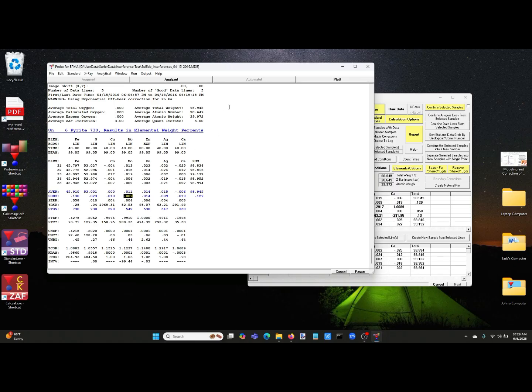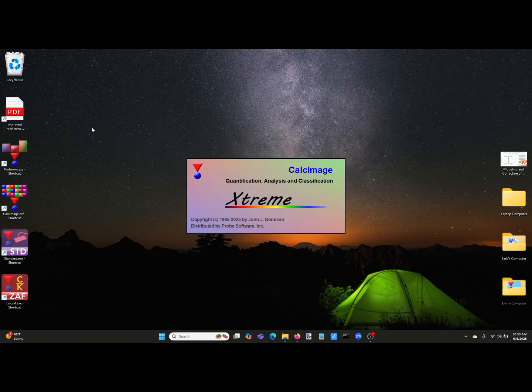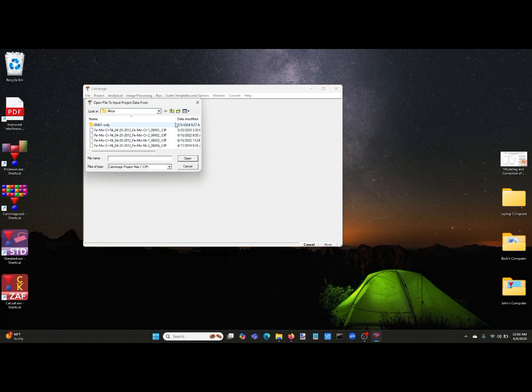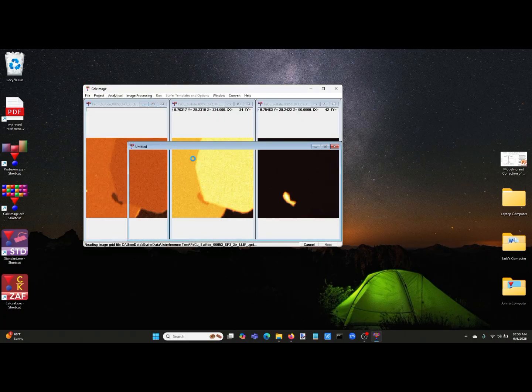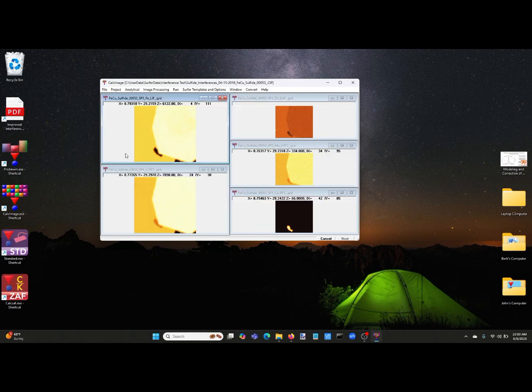Okay. Next, we can also do the same type of analysis for maps. So here's an example of a mapping run for those same elements. And we'll open up this project that we've already imported. And there's our mapping run. I've made 2 projects, one without the interference correction, one with the interference correction. That can be turned off very easily, as we saw before. So here's our material, and we can close the off-peak images and just see the on-peak images.